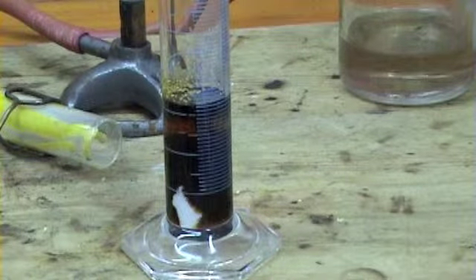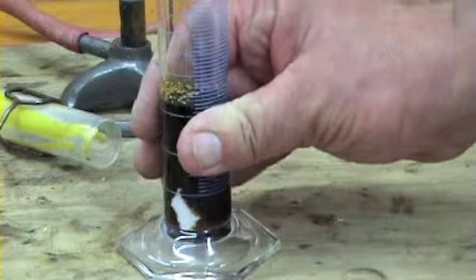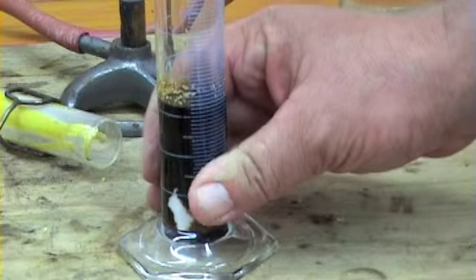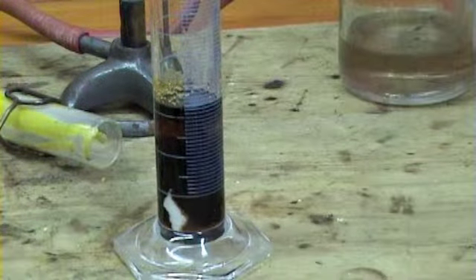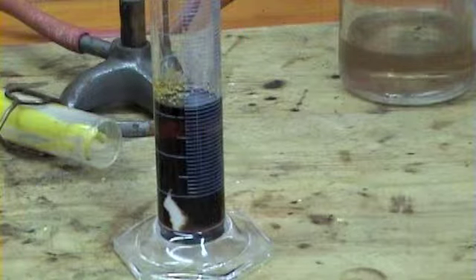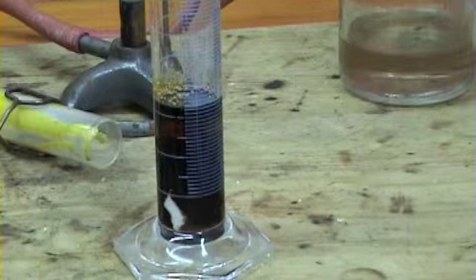Alright, so we've got quite a bit of blackening forming there now, and you think, oh well, it's all going. It's not. The temperature is warm. It's, I don't know, maybe 40 degrees around the outside there now. I certainly wouldn't be putting one of my thermometers in there. Concentrated sulfuric acid.